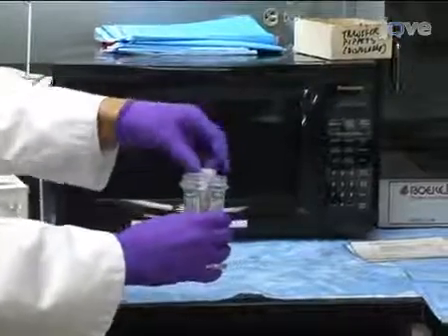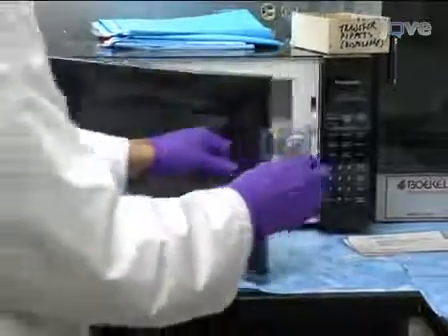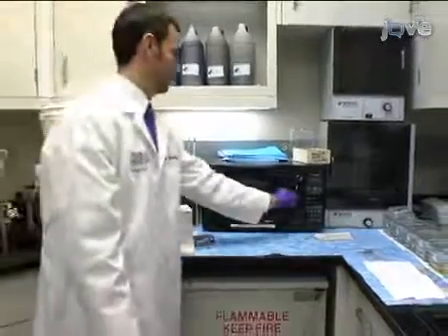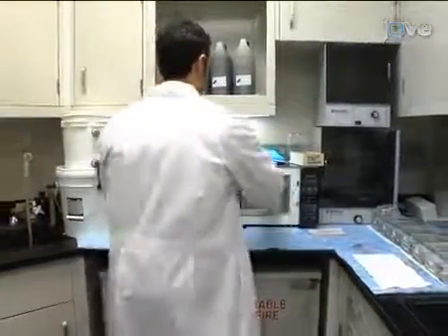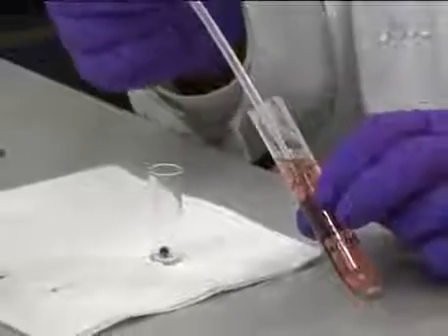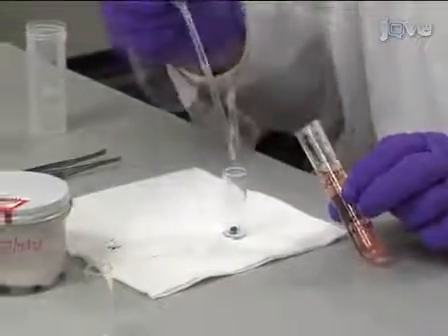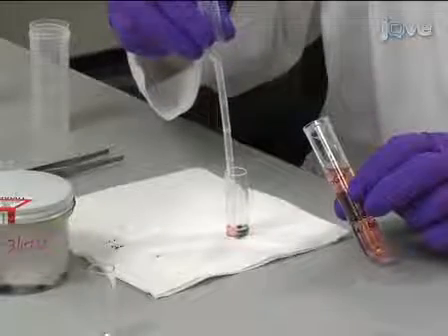Now begin the process of adding the gel. Liquify an aliquot of histogel by melting it in a microwave for 10 seconds at medium power or follow the manufacturer's instructions. Add 0.5 milliliters of the molten histogel to the tube containing the sedimented cells, quickly mix and recap the tube.